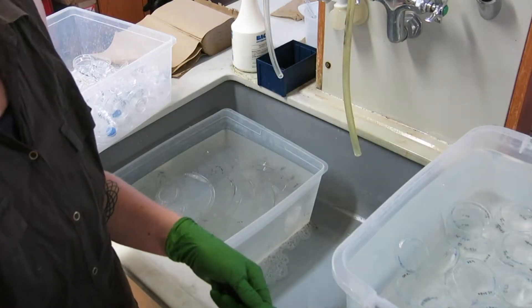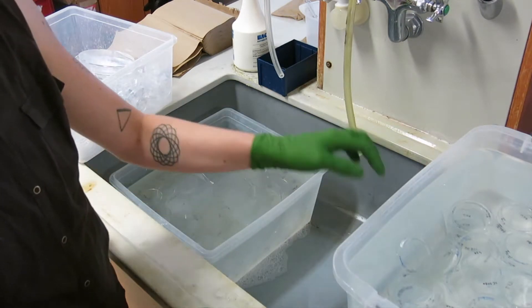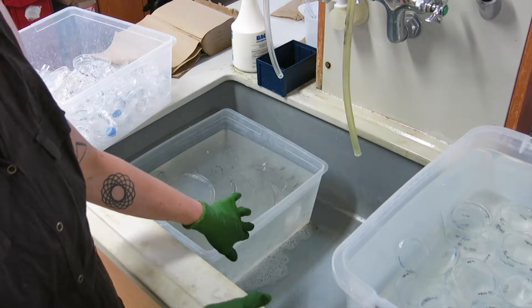After you've taken any agar out, the next step is to soak it in bleach overnight. It's just a little bit of bleach, maybe like 5%, like you would do with glass pipettes. These are my glass ones and this is my plastic.